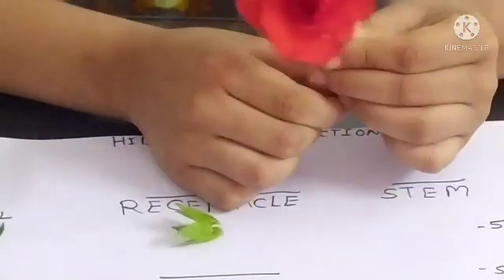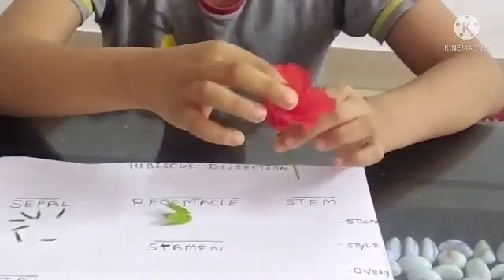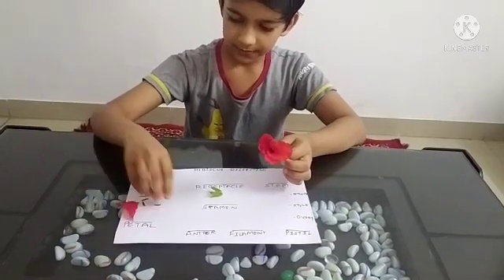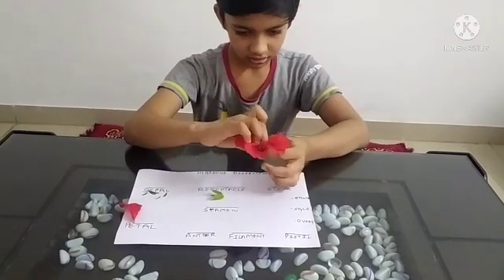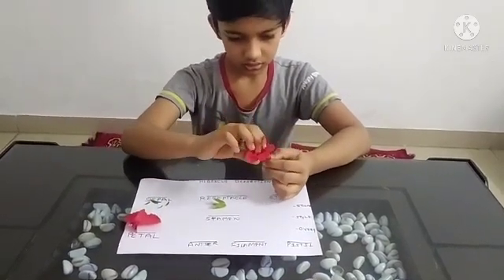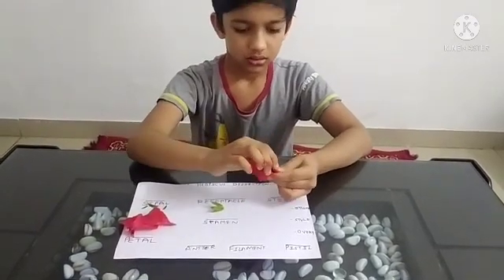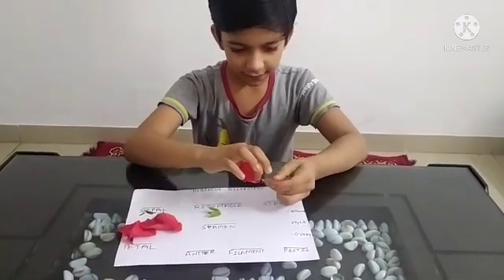Now, the thing which attracts the insect is petals. We will now remove the petals. First petal, the second petal, the third petal, the fourth and the last petal. Now the fifth petal.